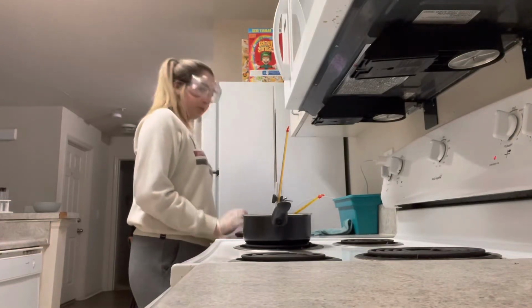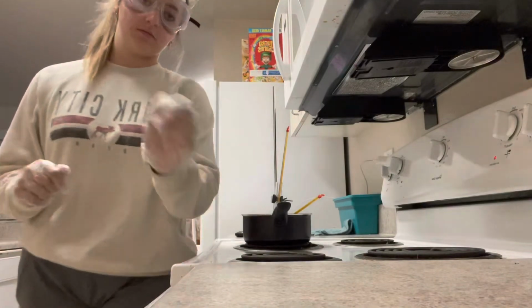We will head on to part C while this is melted.